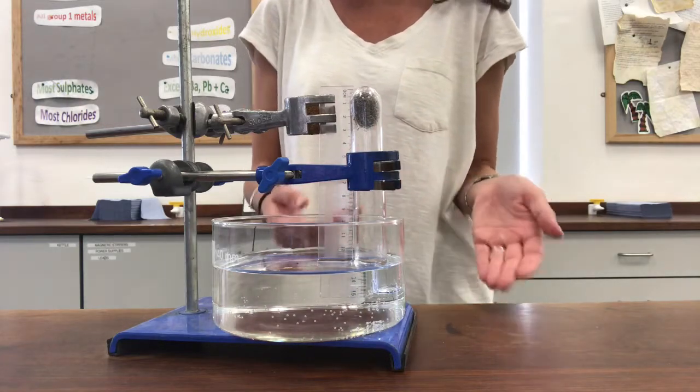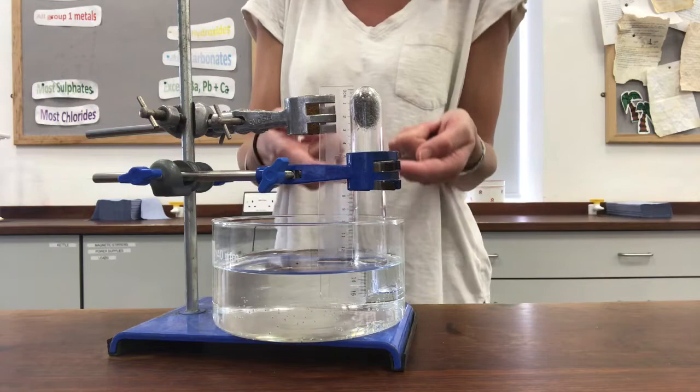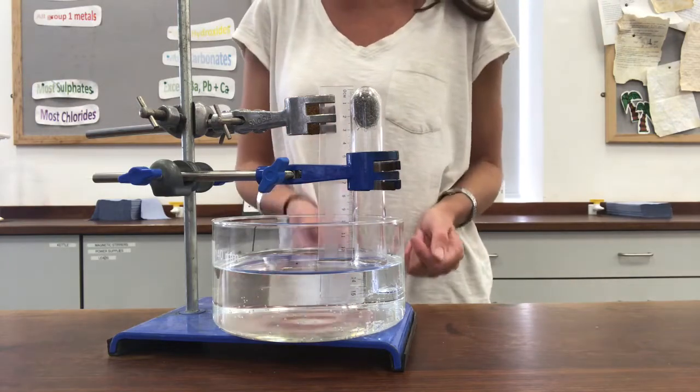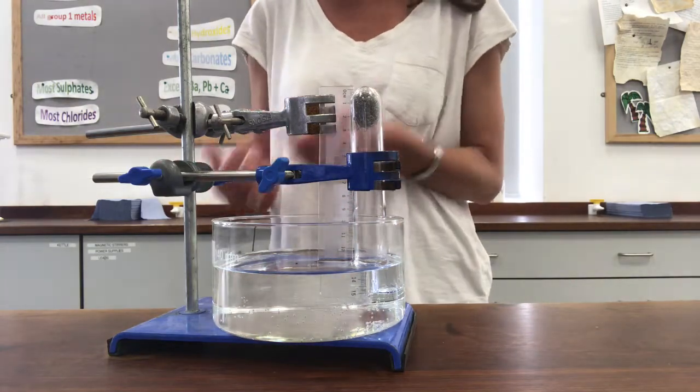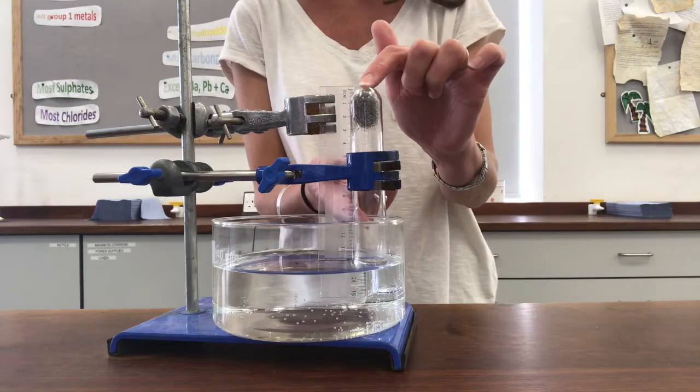I'm hoping that as it does that, the water level will rise inside the boiling tube. And after a week, we'll be able to measure the length of the air bubble that's in the tube.